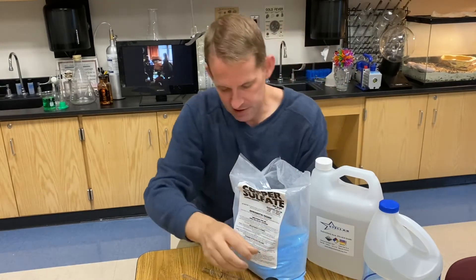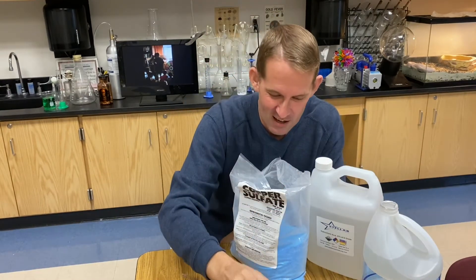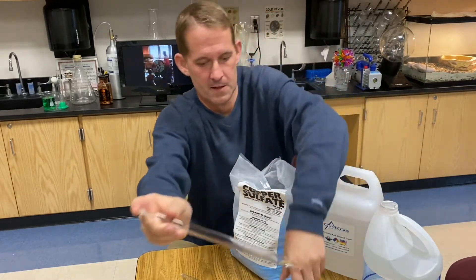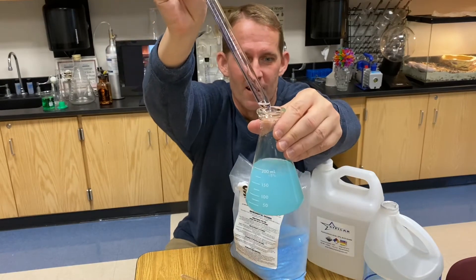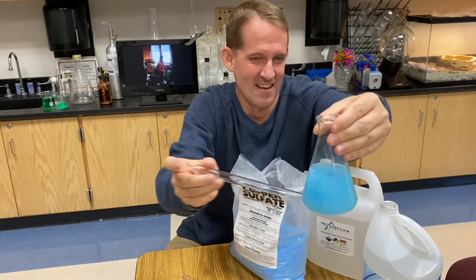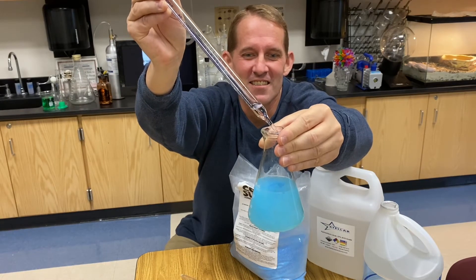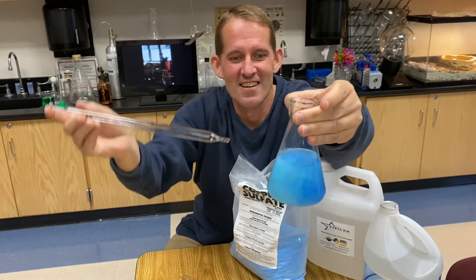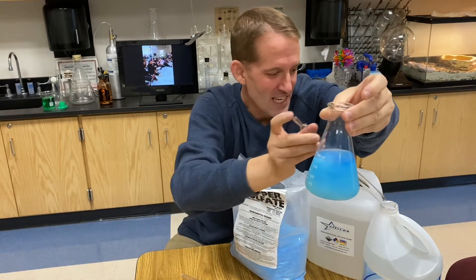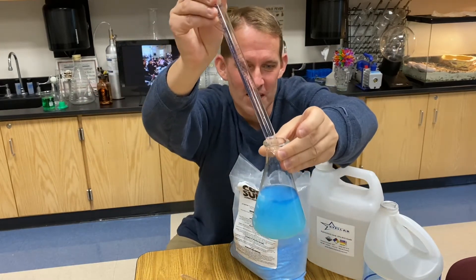I'm going to add just a few drops of ammonia to disrupt the equilibrium and find out what happens. Right away you'll see a change — the ammonia changes my copper sulfate into the insoluble copper hydroxide. Do you see that cloudy solution? If I keep adding ammonia, it'll continue to change into this dark, deep blue solution.